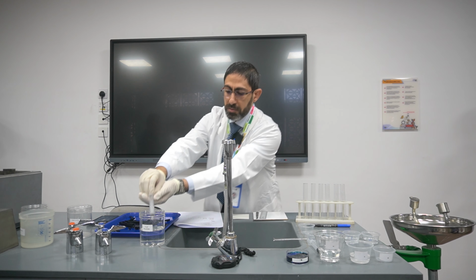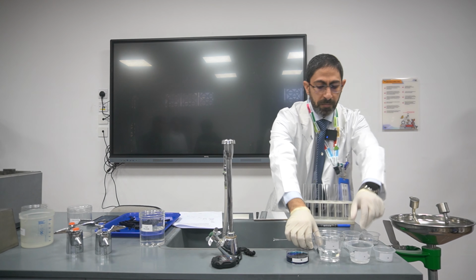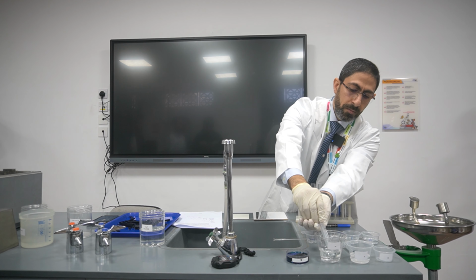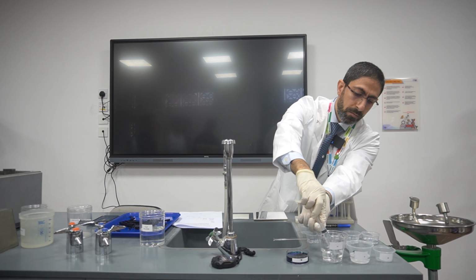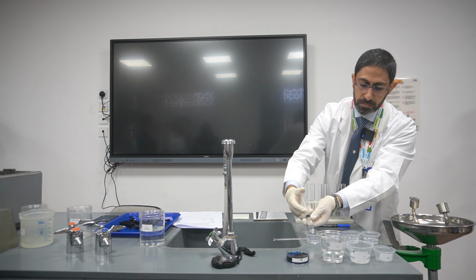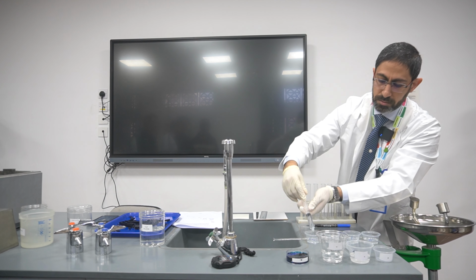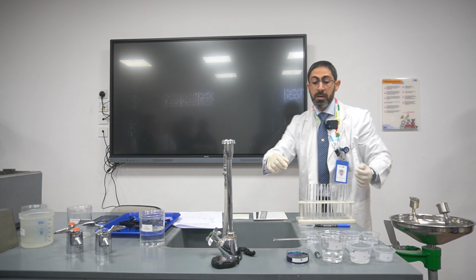I will clean it, not to forget. Okay, back again under the salt. Take from here 18 centimeter cubed. Sorry. Here is 10. Here is another 8. Okay.